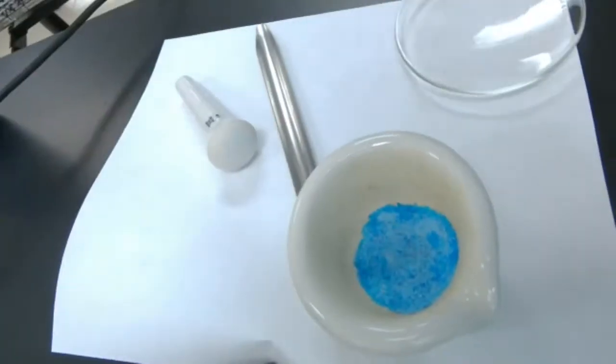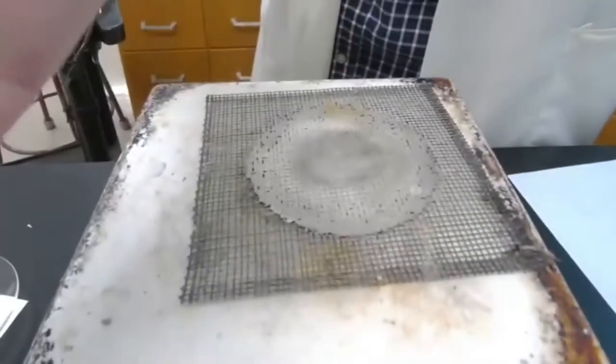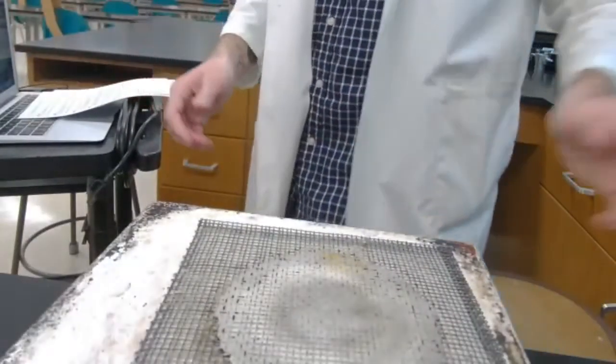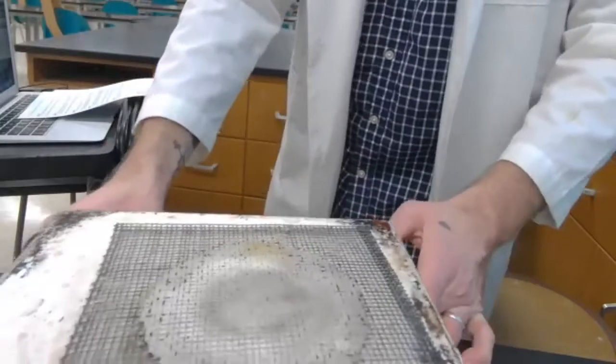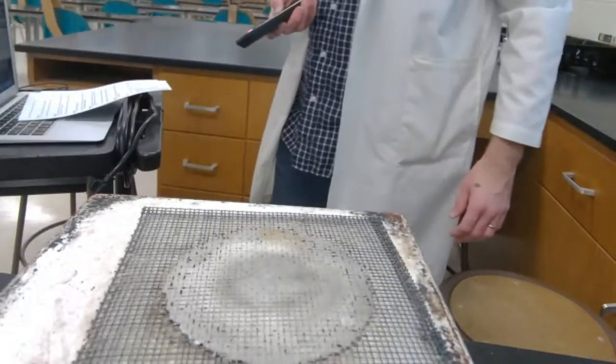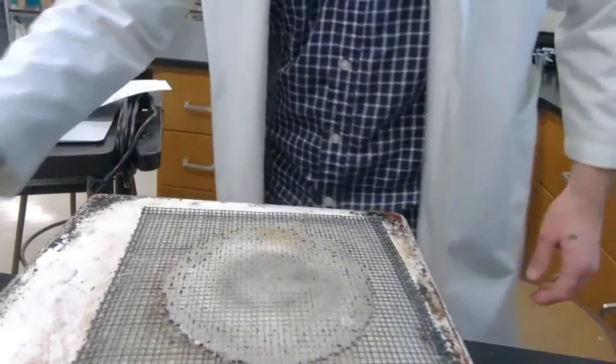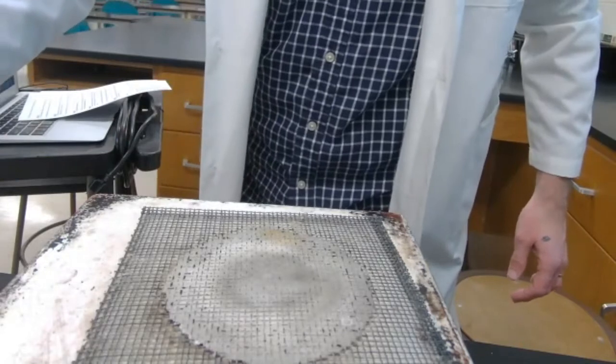Whoa, earthquake. I'm going to bring you over here. You guys can see the hot plate. Look, as long as it behaves and doesn't fall. Oh! You guys all right? Okay, maybe. There we go. So you'll be able to see into my setup there. Zoom down in a little bit. I think that's as far as it goes. We'll figure it out. So I'm going to dump a little bit of that powder.